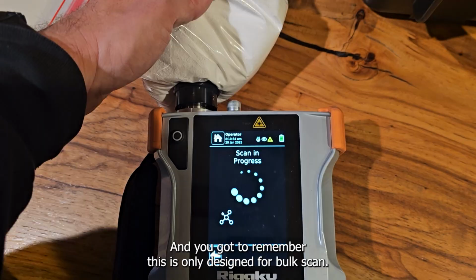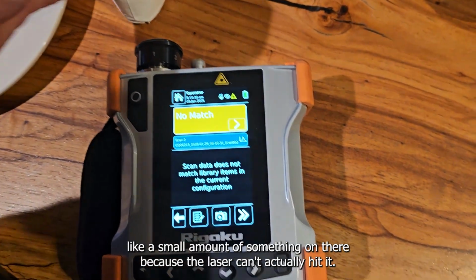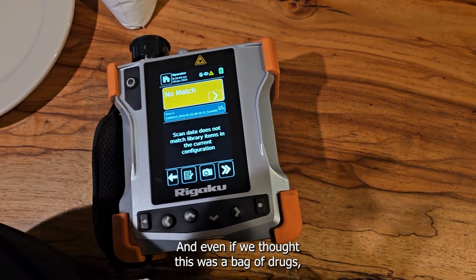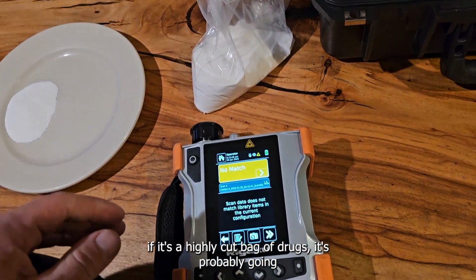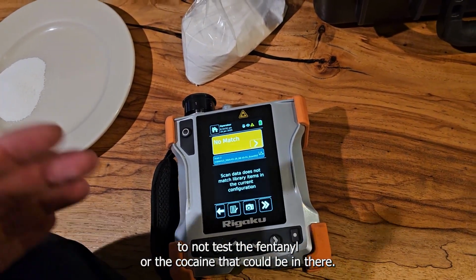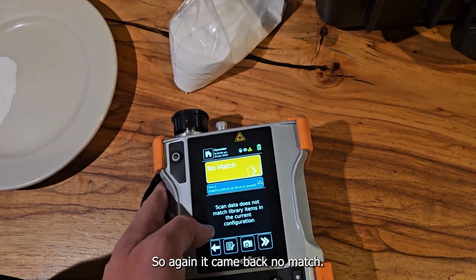And you've got to remember, this is only designed for bulk scans, so we can't test a small amount of something on there because the laser can't actually hit it. And even if we thought this was a bag of drugs, if it's a highly cut bag of drugs, it's probably going to not test the fentanyl or the cocaine that could be in there. It's going to hit all the other stuff. So remember, we have other tests for that. So again, it came back no match.